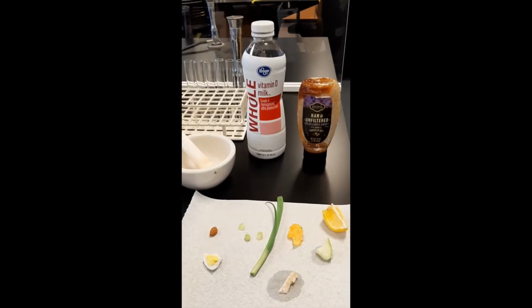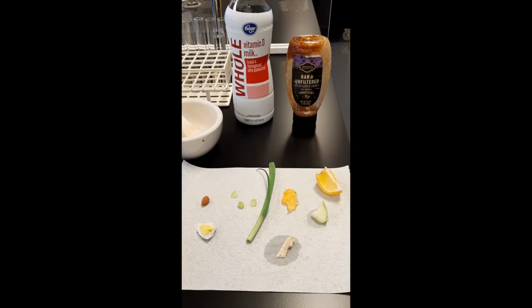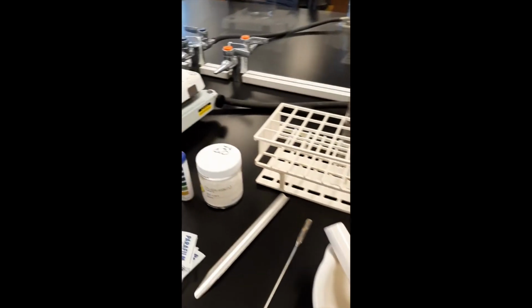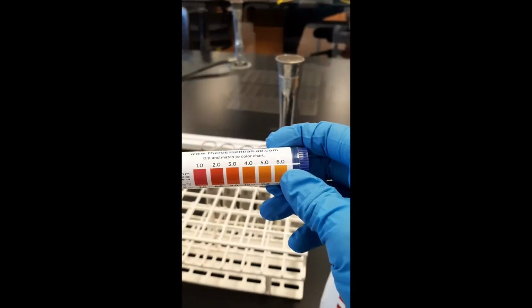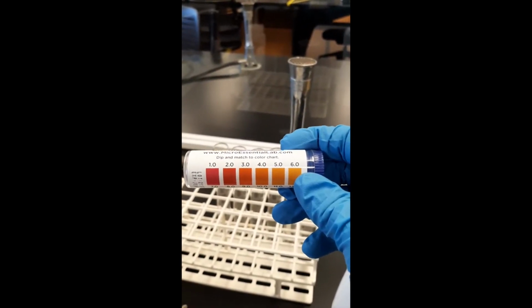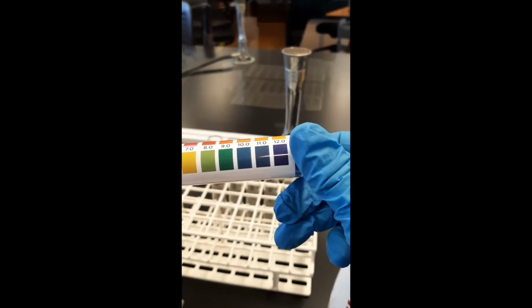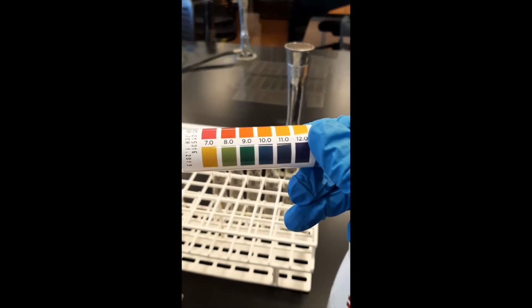So we're going to look for those amine groups that will turn into ammonia when we break apart protein that's present in different foods. And we're going to be able to determine whether or not we have ammonia in our solution by measuring the pH. We'll test for the presence of this base, ammonia. Ammonia is basic, by using these pH strips. And so you can see 12 is the most basic, 1 is the most acidic, and then we have 7 as neutral.